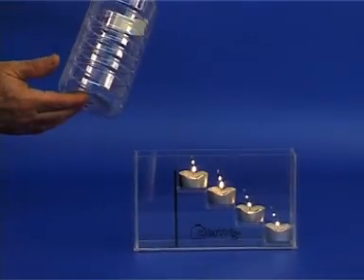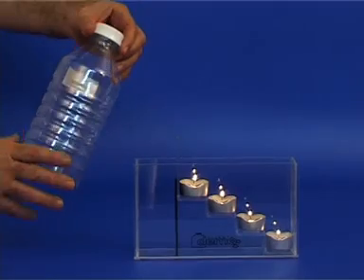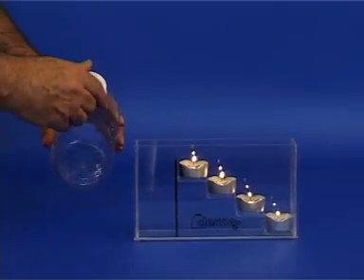Next, examine the bottle of carbon dioxide and note that it is transparent and does not contain anything visible to the eye.